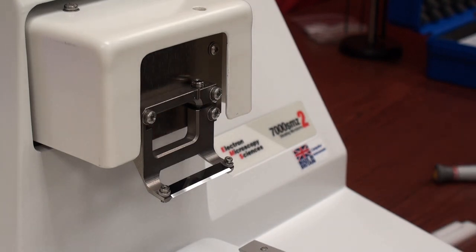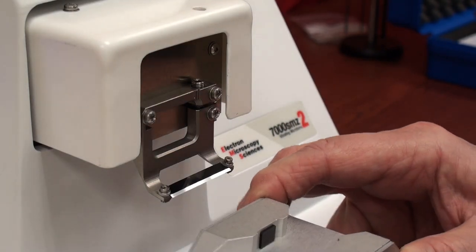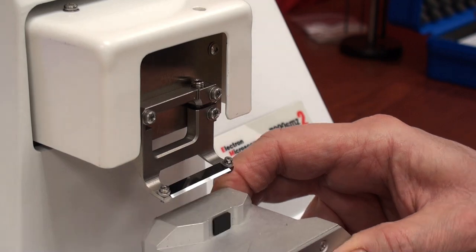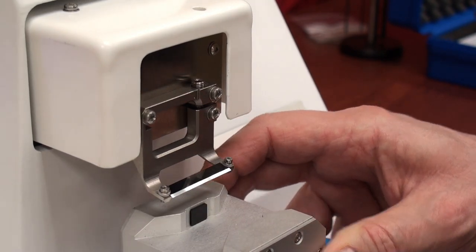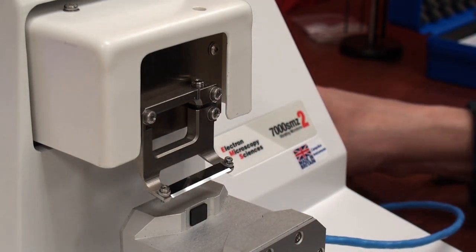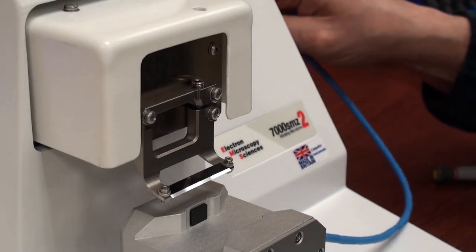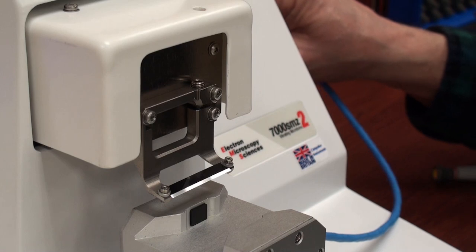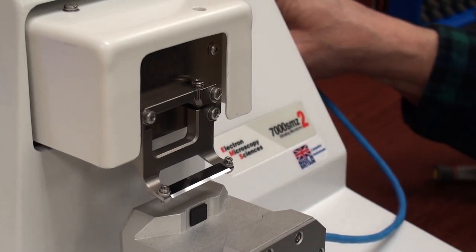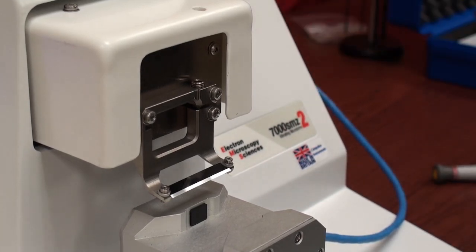So what we're going to do now is we're going to put the Opti-Cal system in place. So again, the bath is in the load position because you want plenty of clearance between everything and the knife. You don't want to dull it. You plug in the Opti-Cal system.